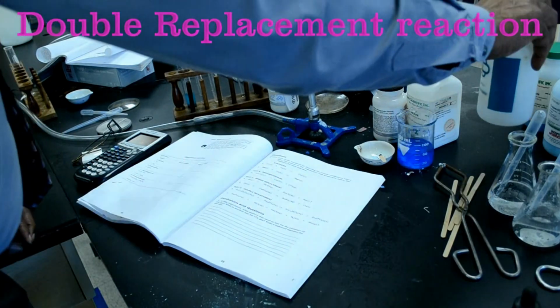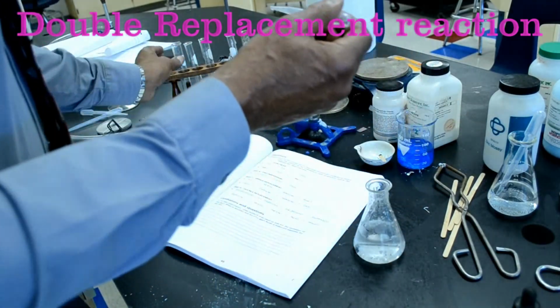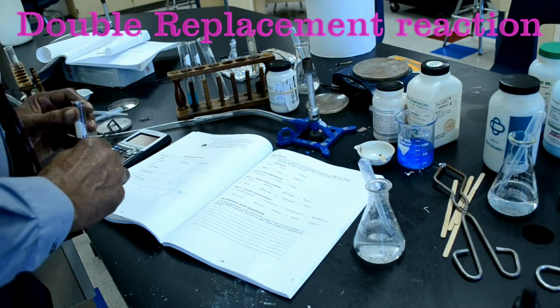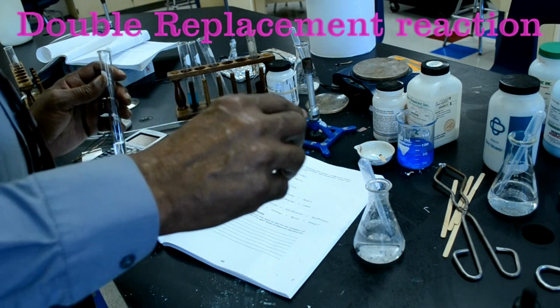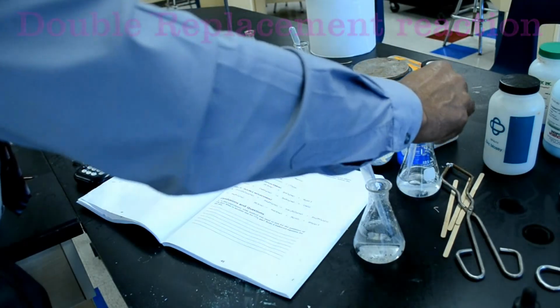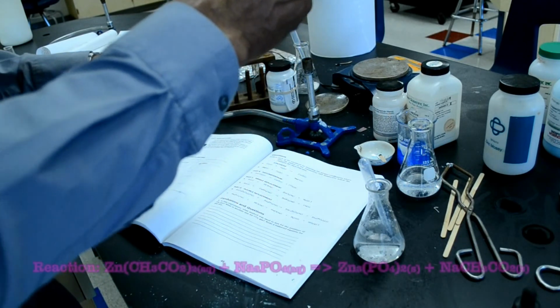Number 9, place about 2 mLs of zinc acetate. I'm going to place about 2 mLs of zinc acetate into a clean, dry test tube. Add about 2 mLs of sodium phosphate. This is sodium phosphate. And observe what happens. Note any changes to the mixture.